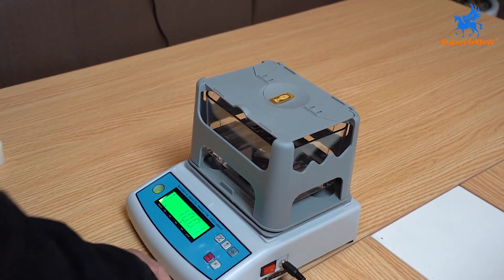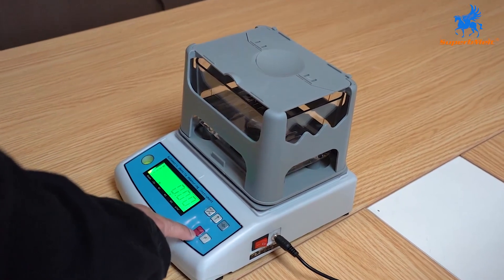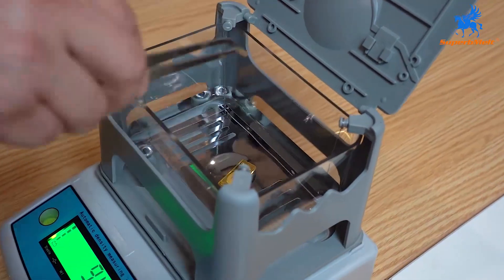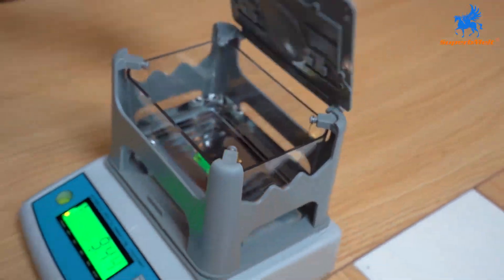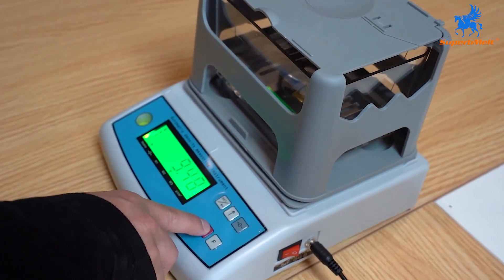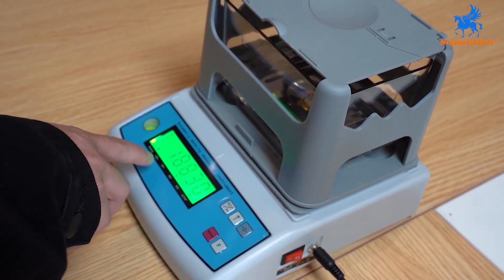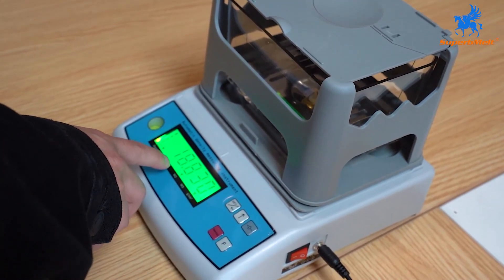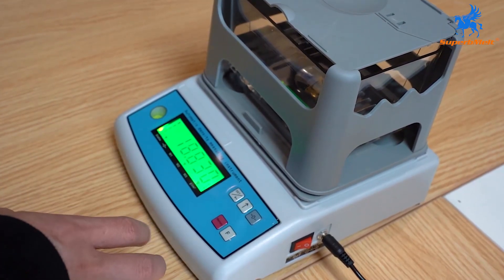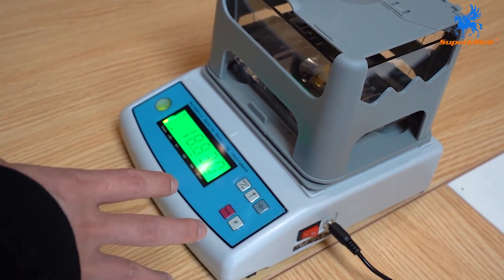Press here — it means stock storage. Put it in water. Press storage again and keep it stable. The density shows 18.83, which is close to gold. We can think it is real gold, but we are not sure.